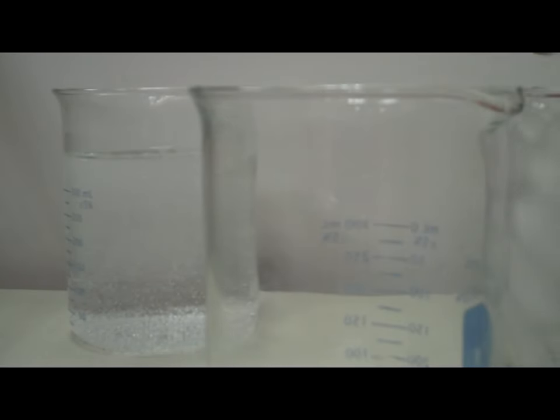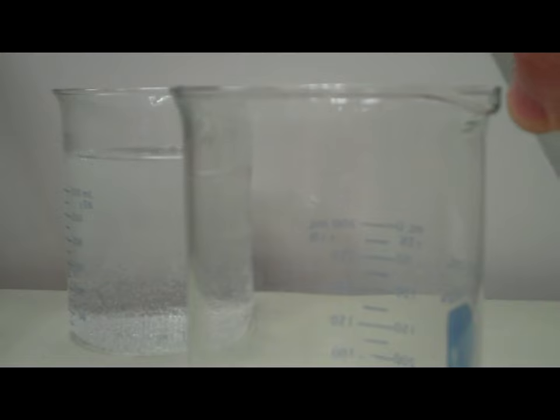Now I'm going to take the ice water and I'm going to pour the water off of the ice so we don't have any ice, we just have the water.